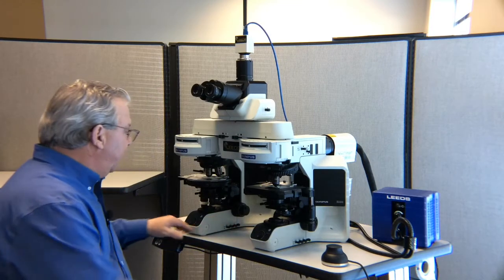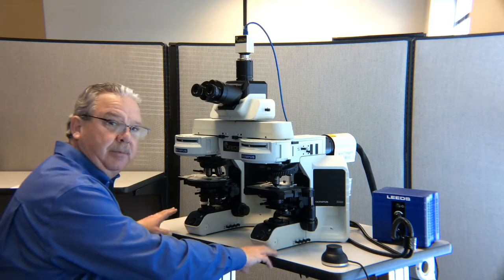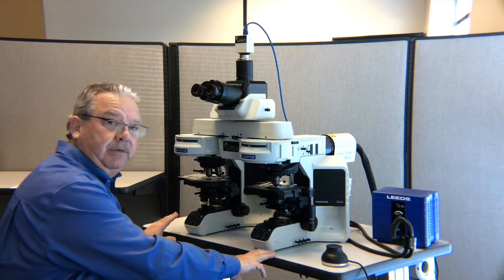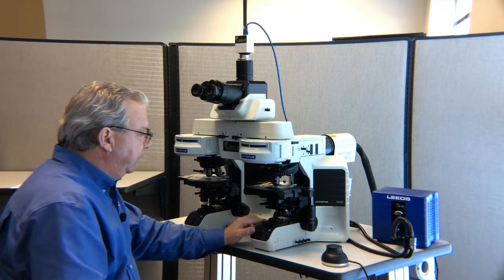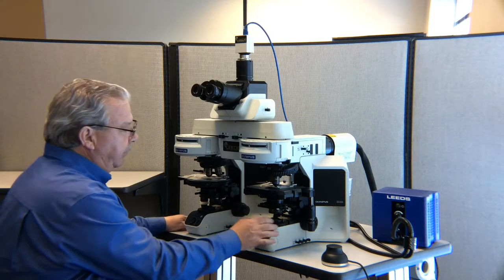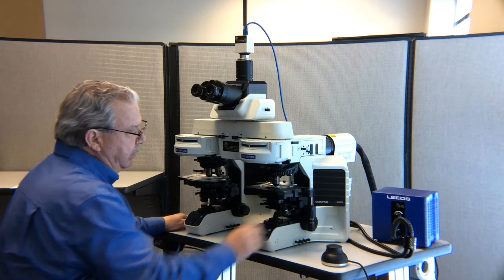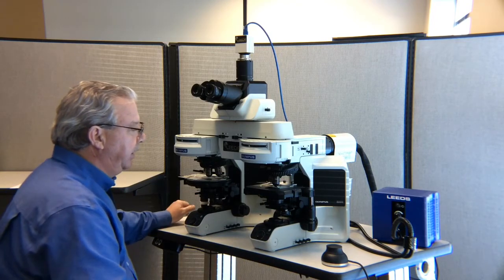Moving up through the ray path, what we're trying to do is get the right and the left microscopes set up identical to one another so that we know that we can achieve the color and intensity balance that we're looking for. Here's our field diaphragm. We're going to come back to that in just a minute. As we move up through here, if we have a polarizer that's removable, you're going to want to remove that from the ray path of the microscope by pushing it to the right.